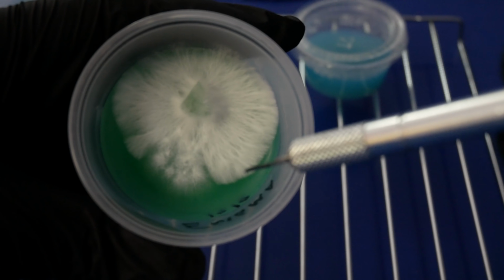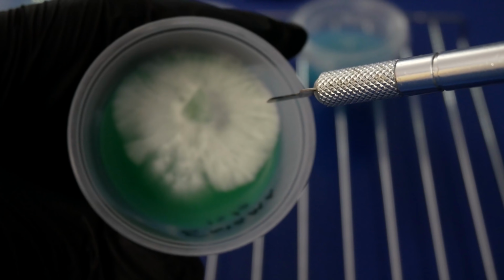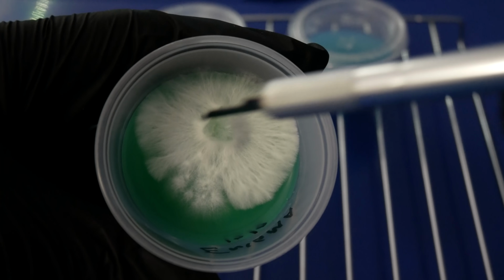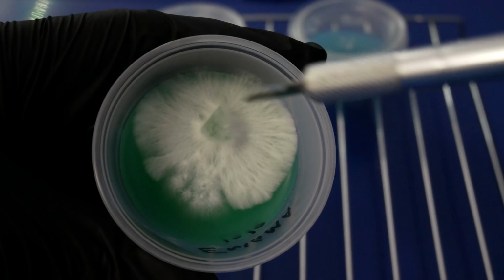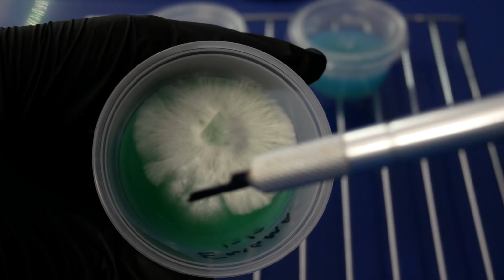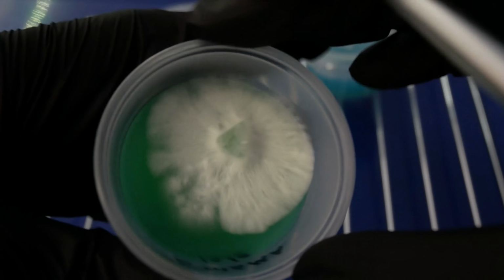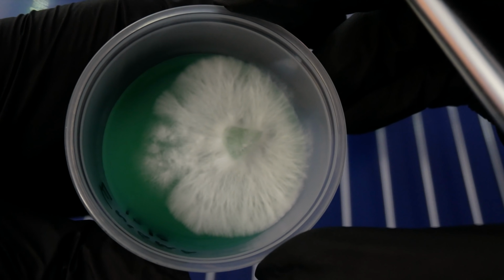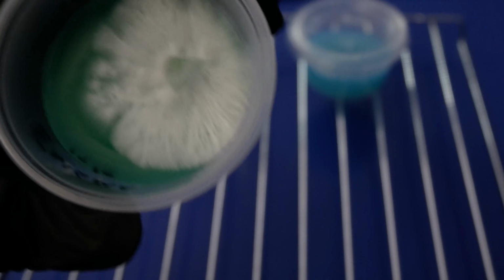Here's one of the sectors. There's another sector. There's another sector. And this part here, I can't tell if that's tomentose mycelium, the cottony stuff. But ideally, when you're looking for fast colonizing mycelium, you want the rhizomorphic growths, the ones that look stringy. Those are the ones that are more aggressive on colonization.